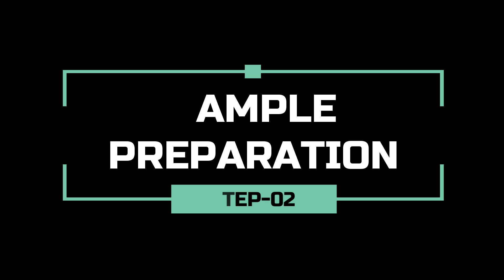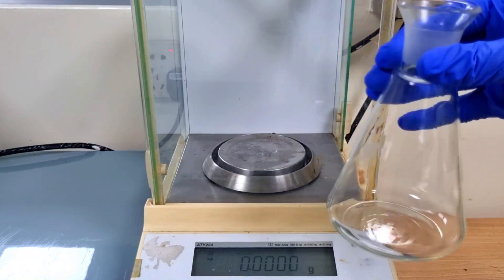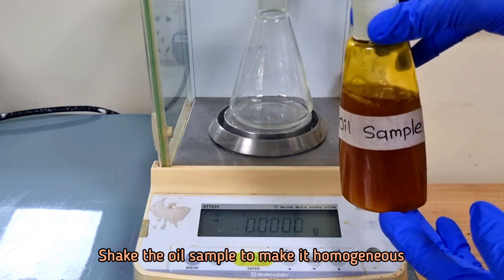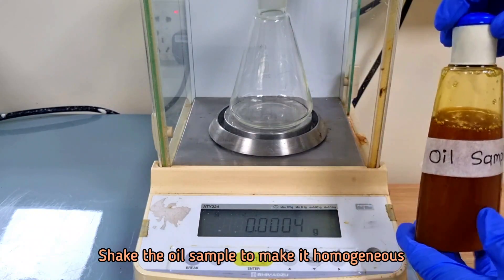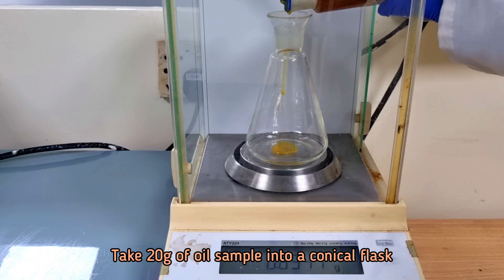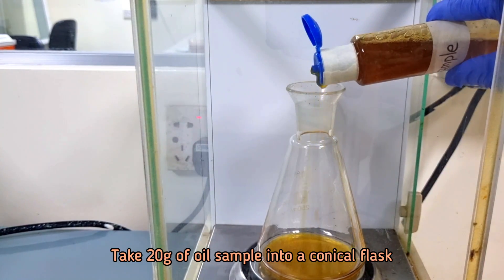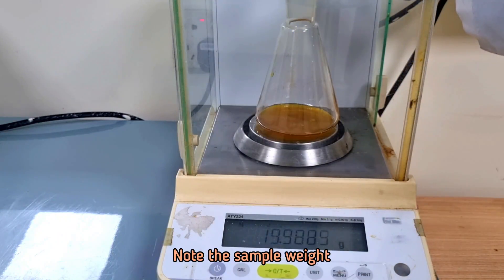Now we will prepare our sample. This is the oil sample to be tested. Shake the oil sample to make it homogeneous. Take 20 grams of oil sample into a conical flask and note the sample weight.